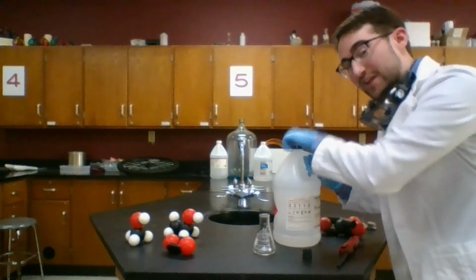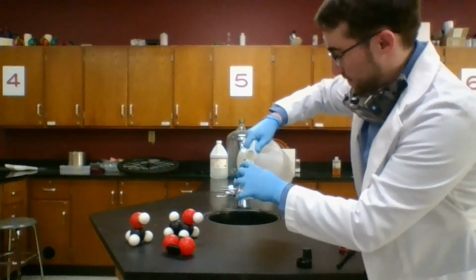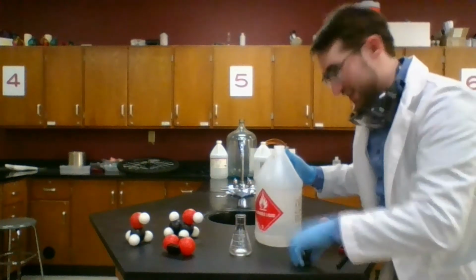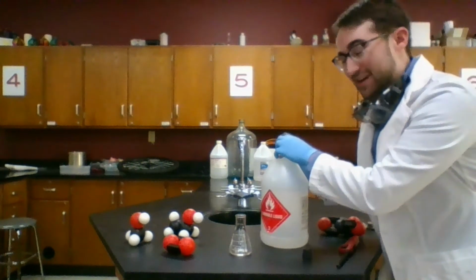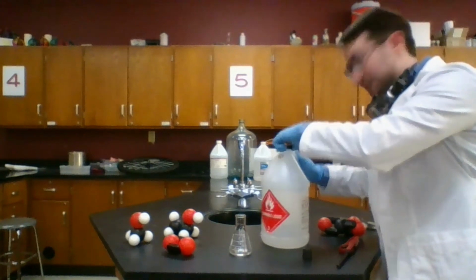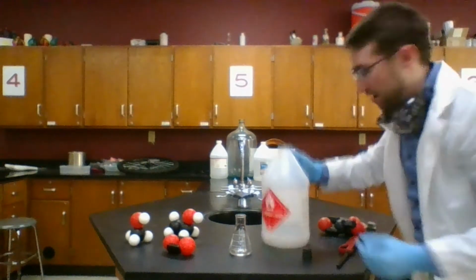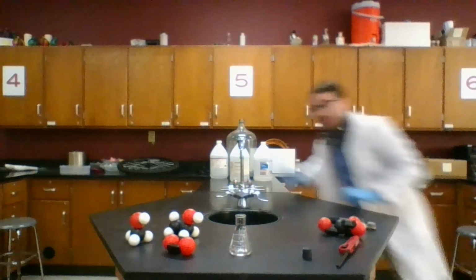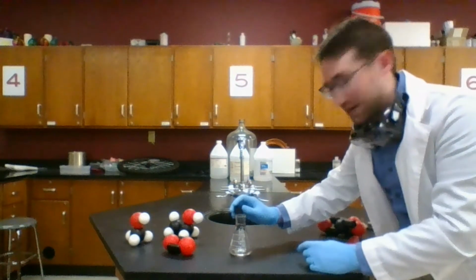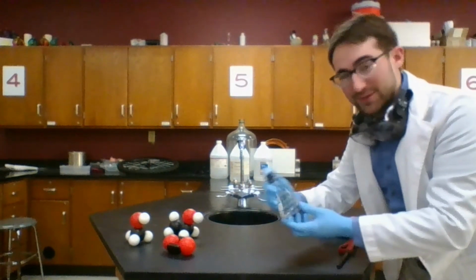So we're going to take a little bit of ethanol, pour it into this Erlenmeyer flask, and we don't need much because, again, the vapor, the gas phase of this ethanol and methanol is where we're going to be burning best. Since gases take up way more space than the liquid that they come from when they evaporate or boil off, I don't need all that much liquid to get this reaction to go well. Now, to get enough vapor to fill the flask to get this reaction to go efficiently, I'm going to cap this with a rubber stopper.